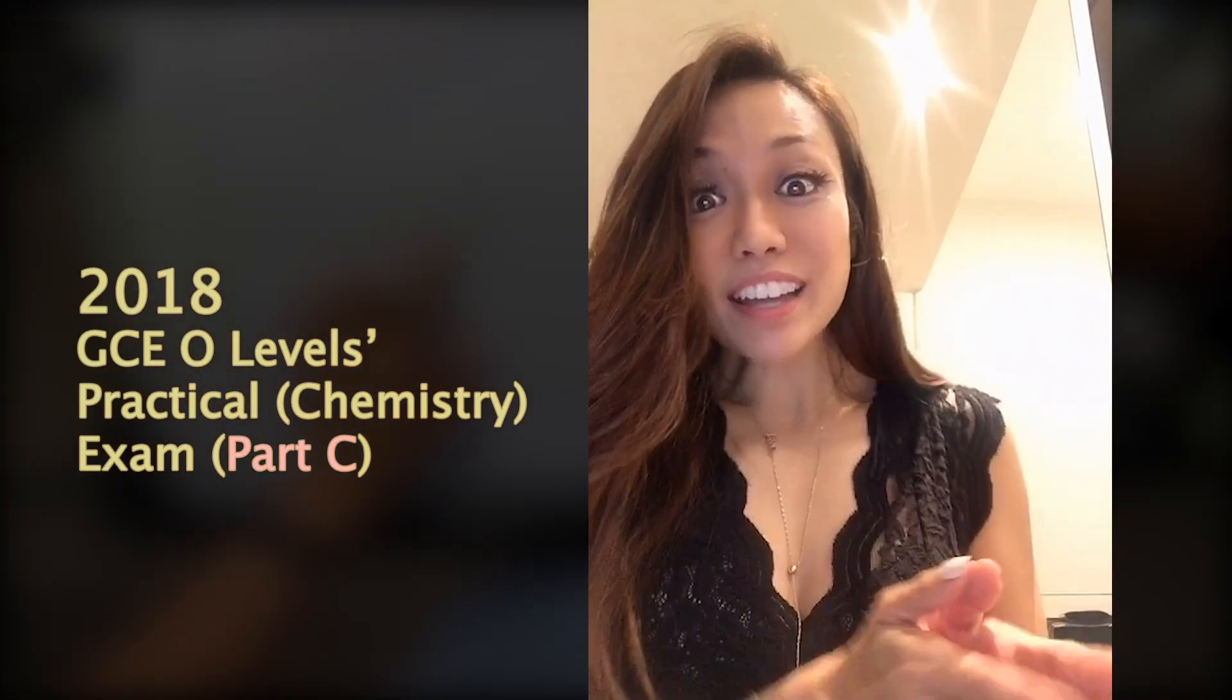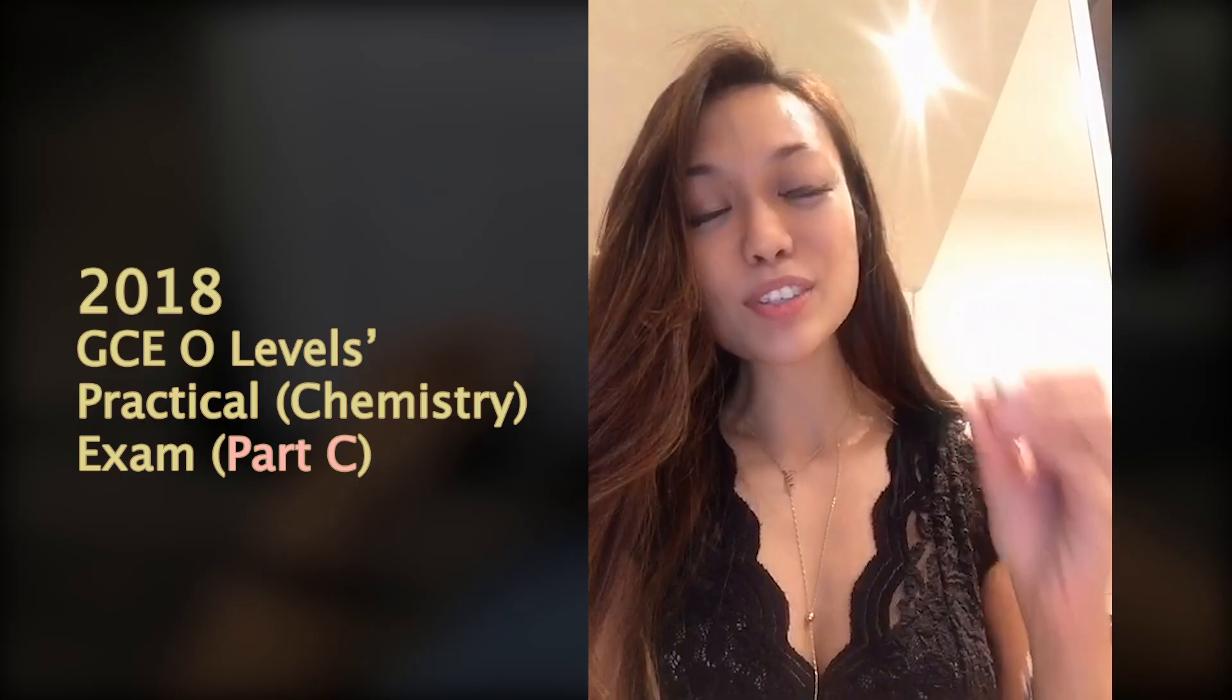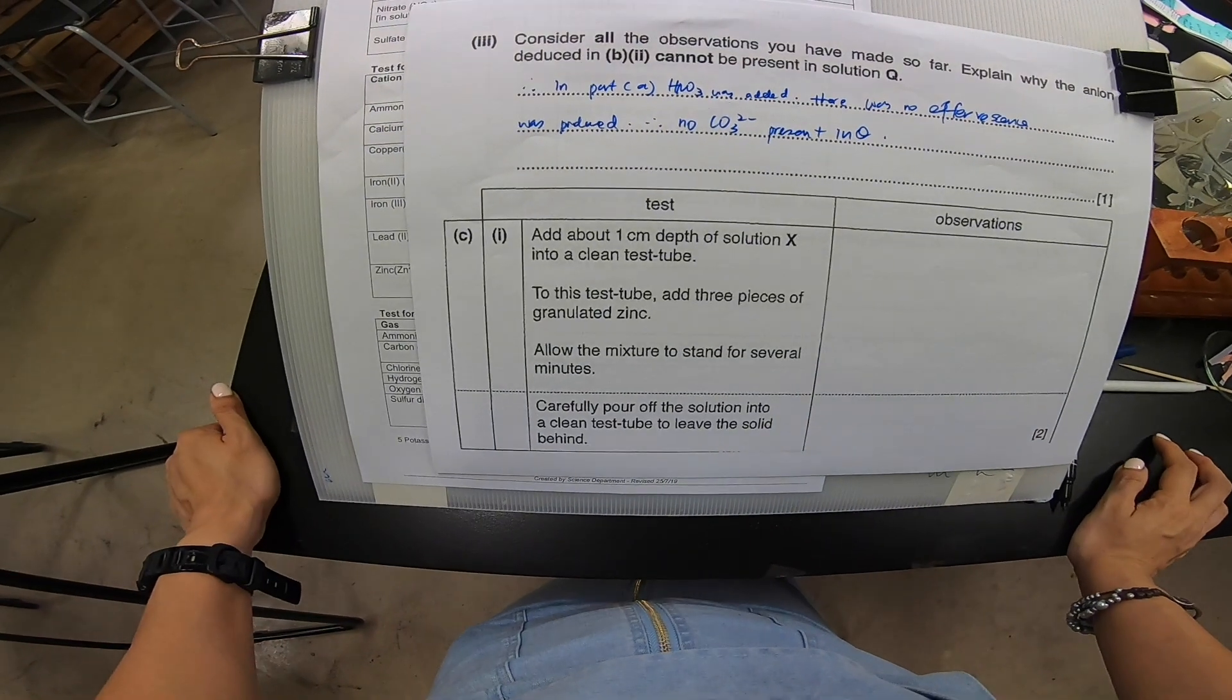Now we have come to part C, the last part of this entire experiment. It's going to be very interesting because for this portion you're going to add something special. This special thing is going to relate back to your theory that you learn. Every time when you're doing practical, remember always link back to your theory.